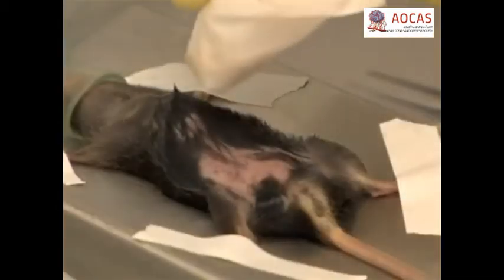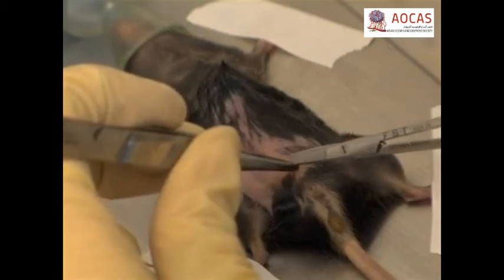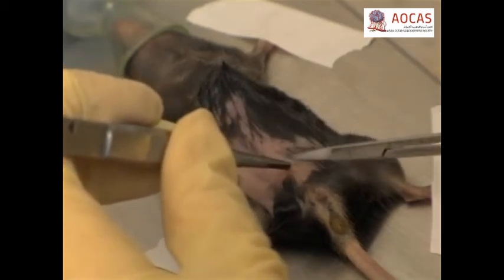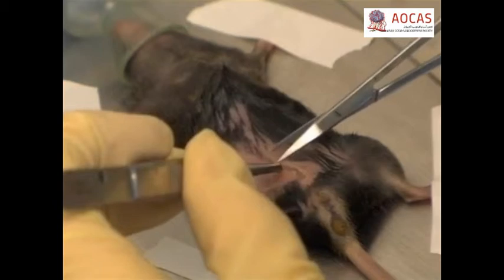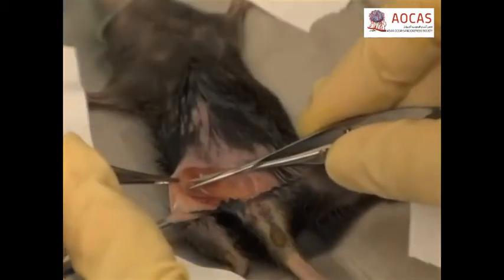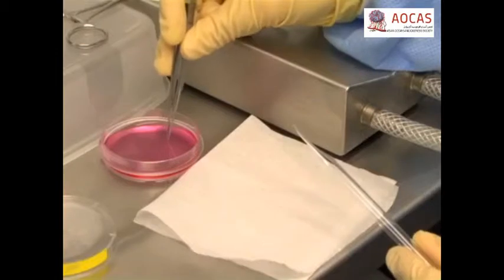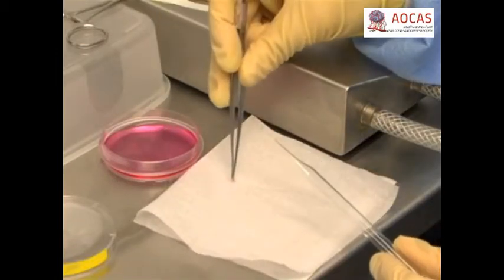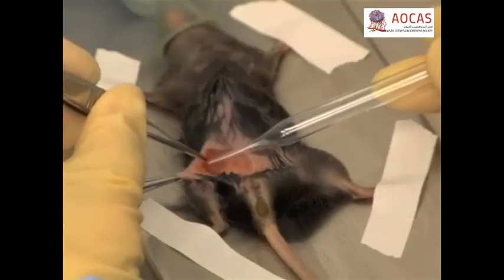Remove the hair with a chemical hair remover such as Nair. Wipe the area clean with water, then disinfect with ethanol and betadine. Hold up a part of the skin by the mammary gland using blunt forceps with one hand. With the other hand, use fine surgical scissors to make an upside-down T-incision between the number 9 and number 10 nipples, or the number 4 and number 5 nipples of the inguinal mammary glands to expose the mammary glands. Make a pocket incision under the lymph node or mammary artery with small surgical spring scissors. Using forceps, remove the collagen graft from the tissue culture dish and drain the excess liquid by gently dabbing it onto a sterile wipe. Slide the collagen graft completely into the pocket using the thin glass rod.